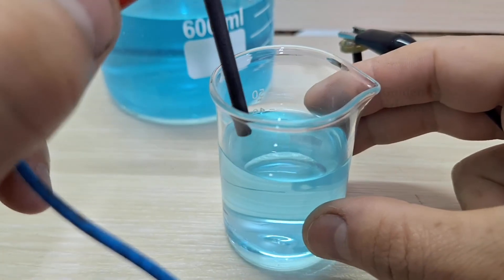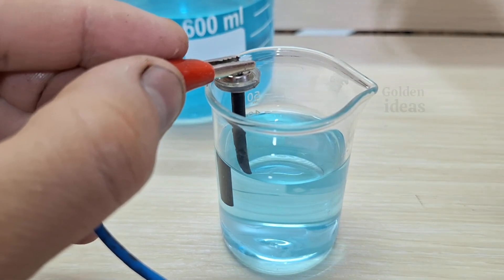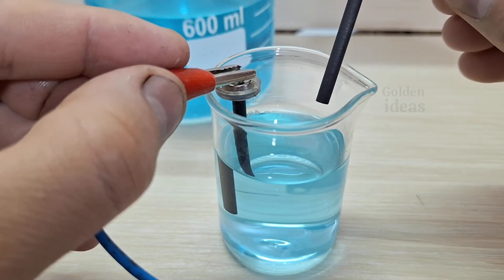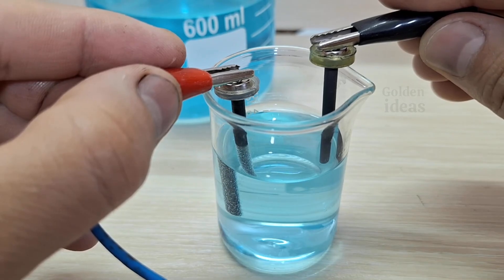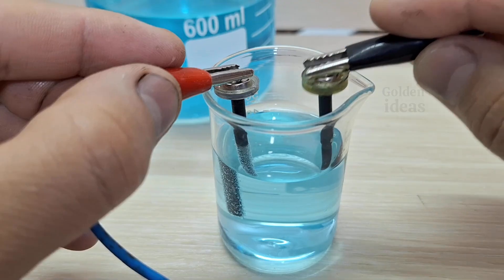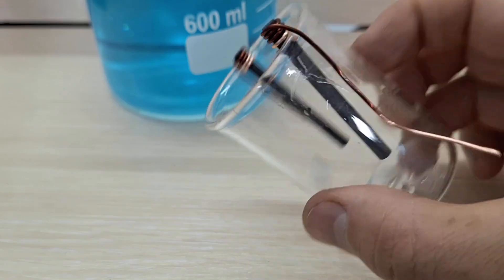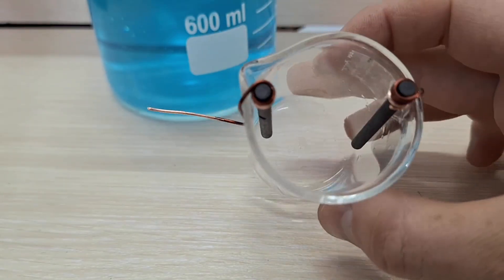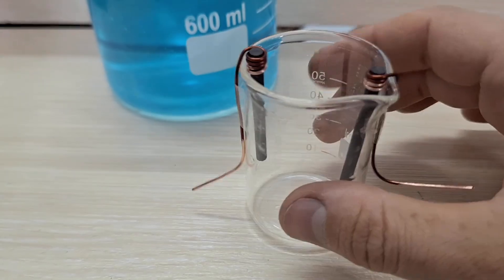Here's an important point, the concentration of the electrolyte matters. If the concentration is too high, not only will it generate excessive heat, but it can also cause some of the gold, copper, and silver in the solution to escape as vapor. I had to use two pieces of copper wire to hold the graphite rods in place, simply because I didn't have another way to keep them steady around the beaker.